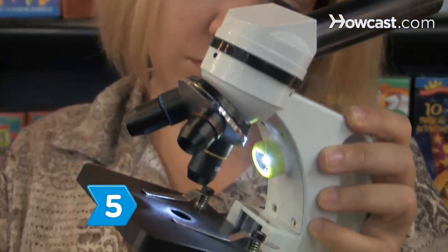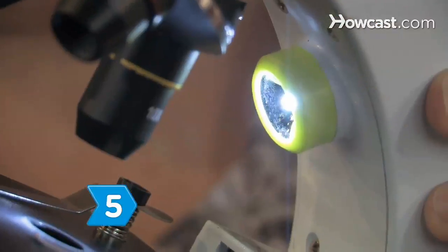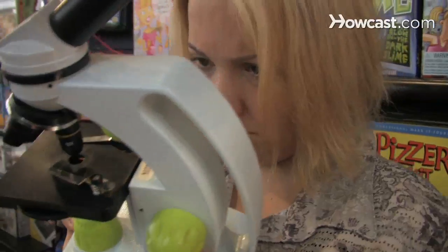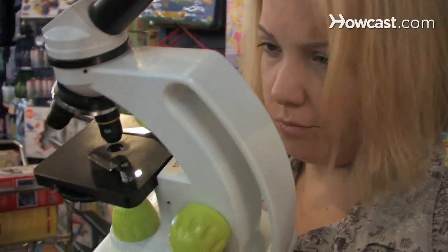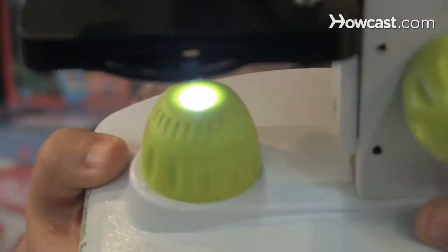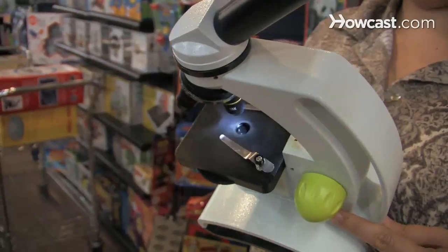Step 5. Consider the light source when you choose a microscope, keeping in mind that LED illumination is cool and better preserves specimens.